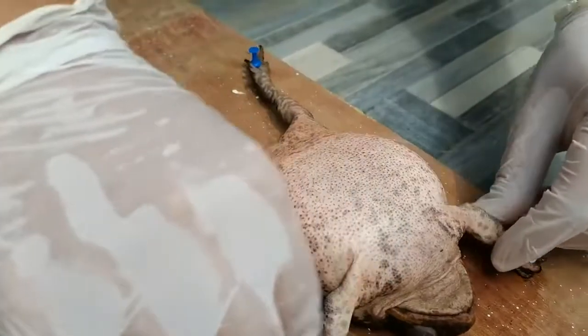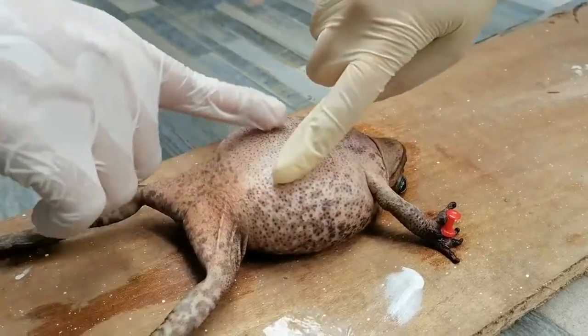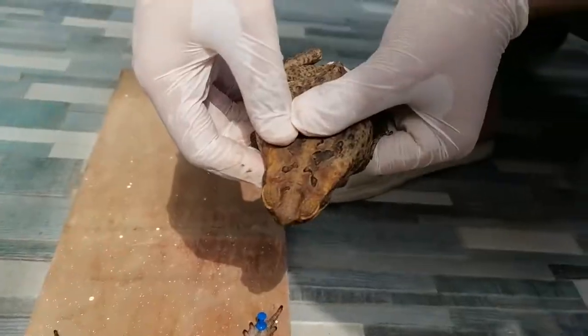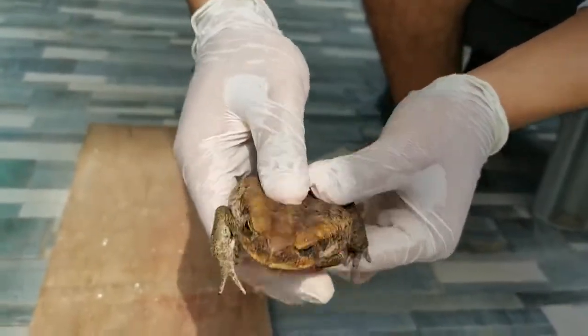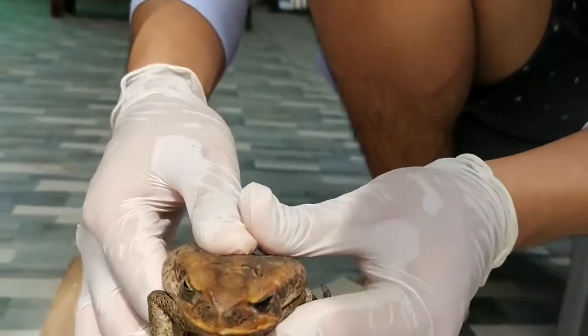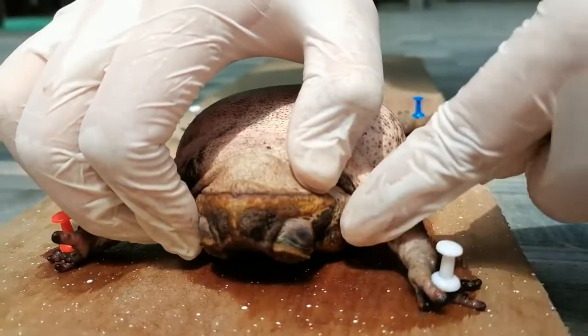We located the hind limbs, which are the longer and more muscular limbs of the frog, as well as the forelimbs, which are shorter than the hind limbs. Examine the frog's head. We located the nictitating membrane that is transparent, covering and sweeping upward over the eyes. We also identified the tympanic membrane or the eardrum located on each side of the head.